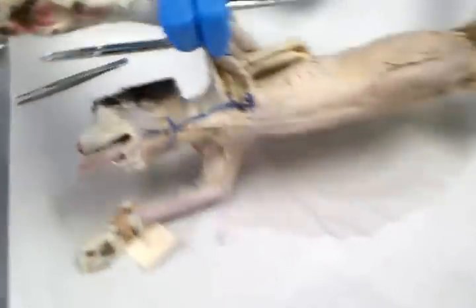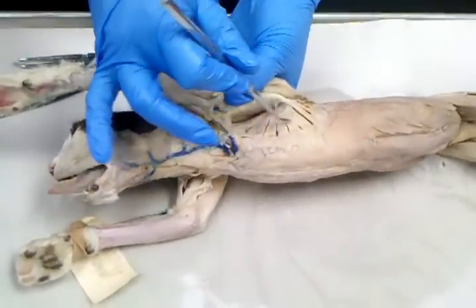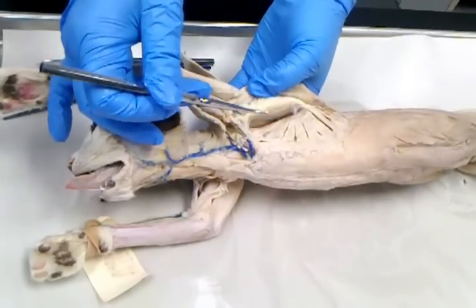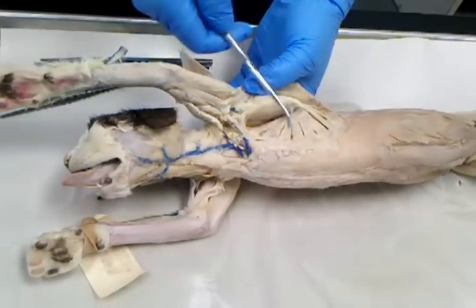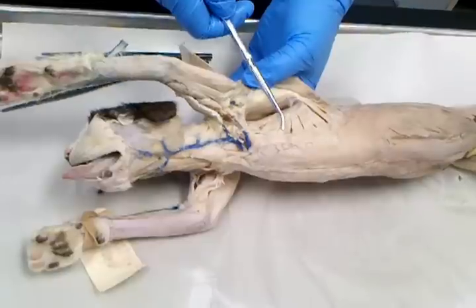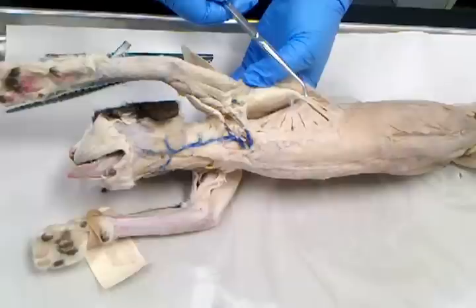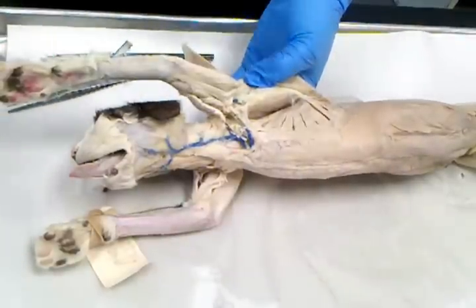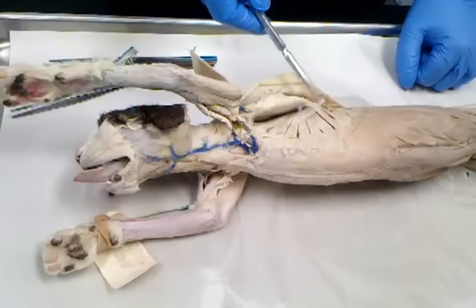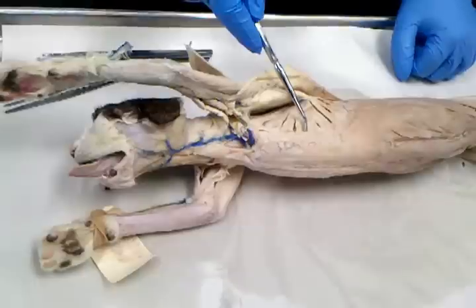There are three deep chest muscles you have to know. You've got serratus ventralis. It kind of looks like a fan, and it's in the armpit area. You can see it. They're not all going to be dissected by teachers, but they're all going to be dissected out. So we're not going to choose something that people didn't actually remove the connective tissue covering and cut out. What is that called again? Serratus ventralis.